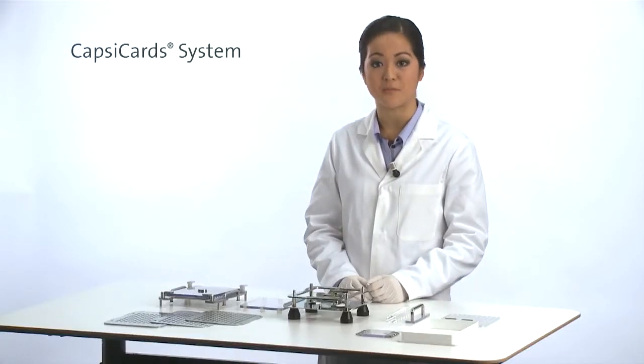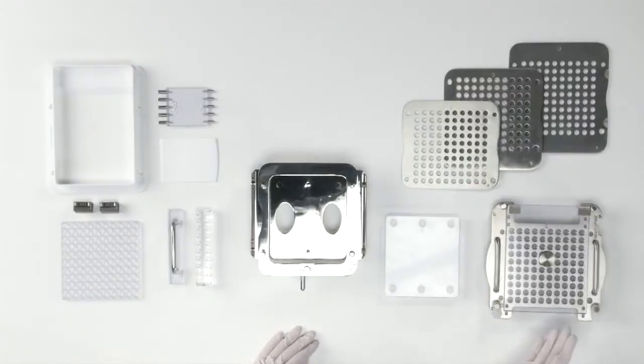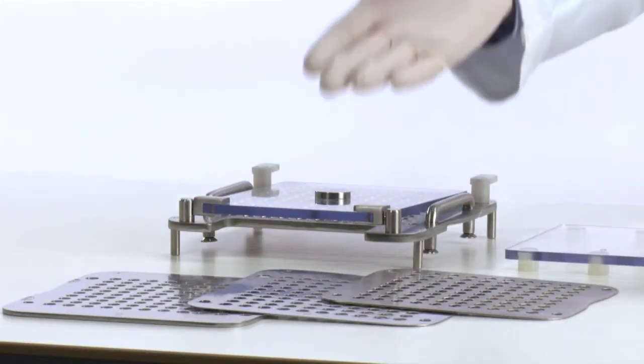Filler change parts are ordered separately. Each box contains the following 5 items: the caps tray with locking plate, the spacer plate and 3 body sheets.